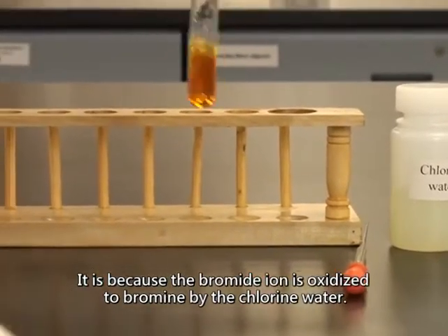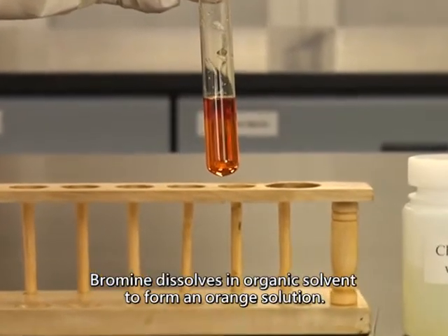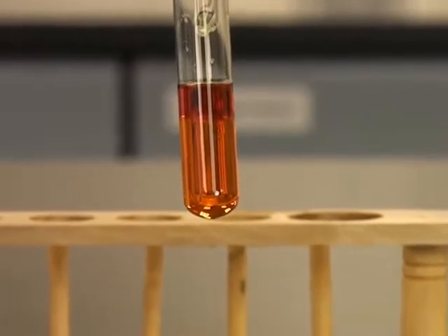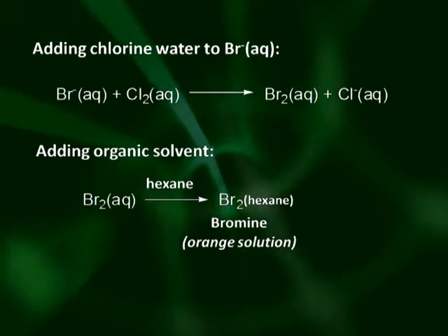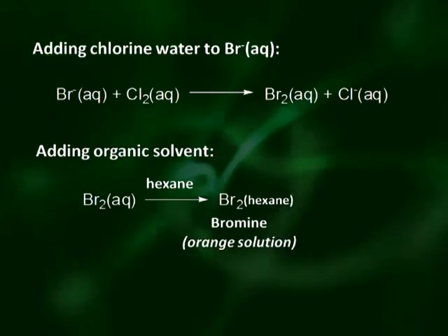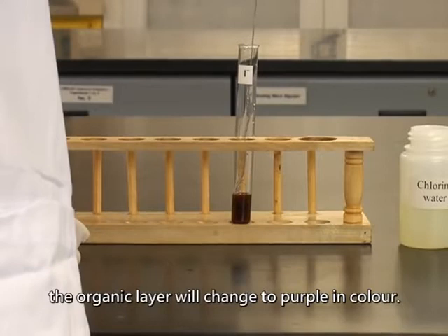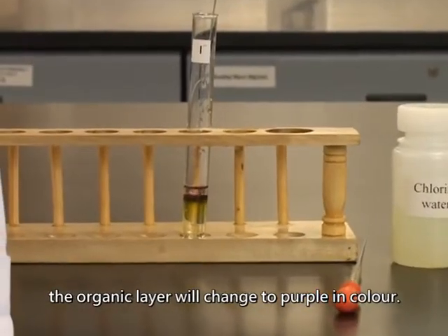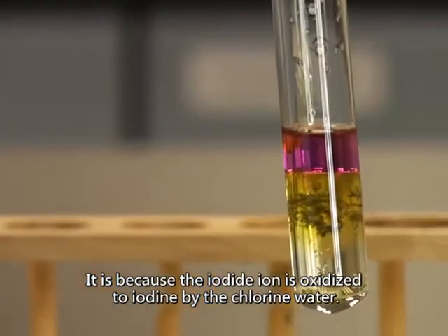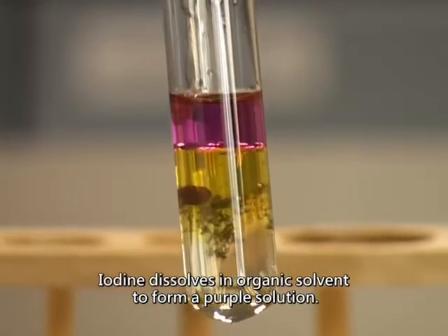It is because the bromide ion is oxidized to bromine by the chlorine water. Bromine dissolves in organic solvent to form an orange solution. If the ion in the sample is iodide ion, the organic layer will change to purple in color. It is because the iodide ion is oxidized to iodine by chlorine water. Iodine dissolves in organic solvent to form a purple solution.